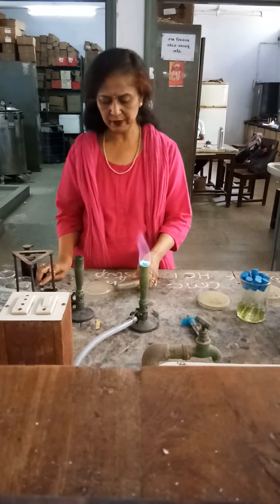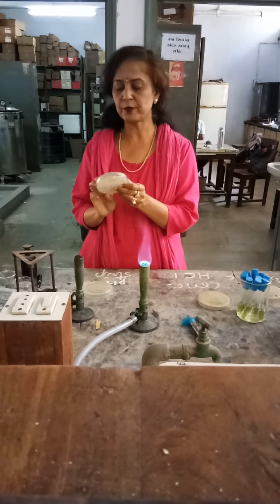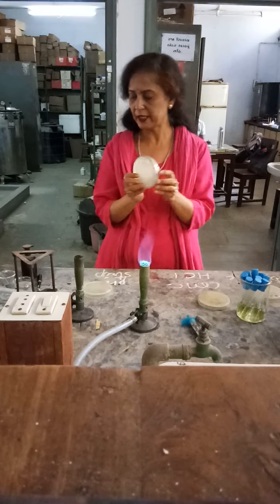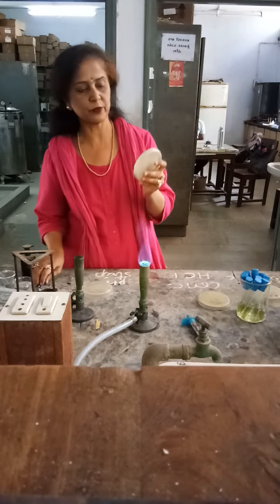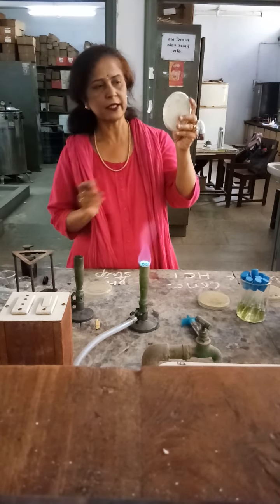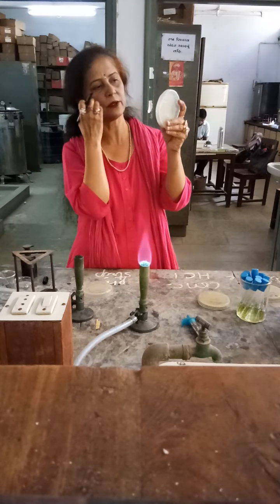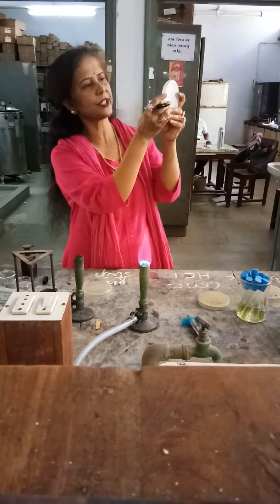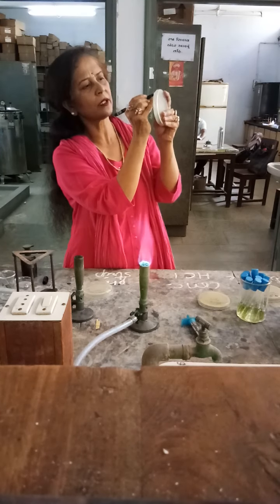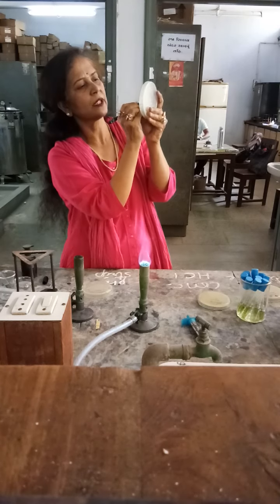After that, we go for the pour plate technique. In the pour plate technique, you can see that it is just like a lawn formation. In this lawn formation, you will try to see whether you can get a clear circular area around the colony of antibiotic-producing bacteria, and you can mark those colonies with their circular zone.